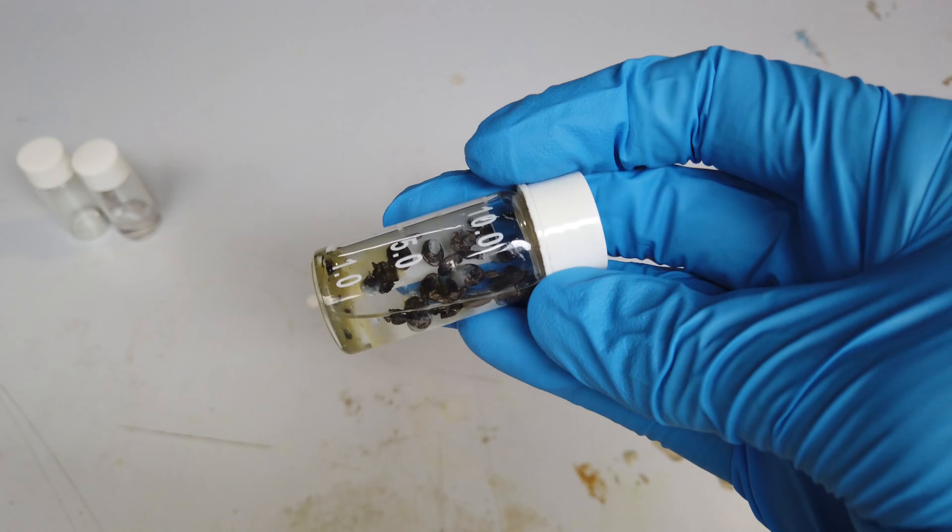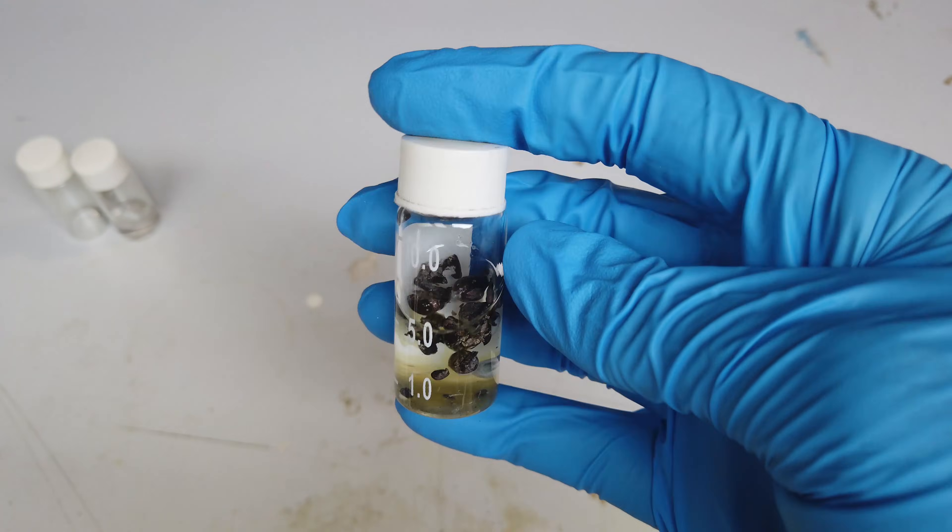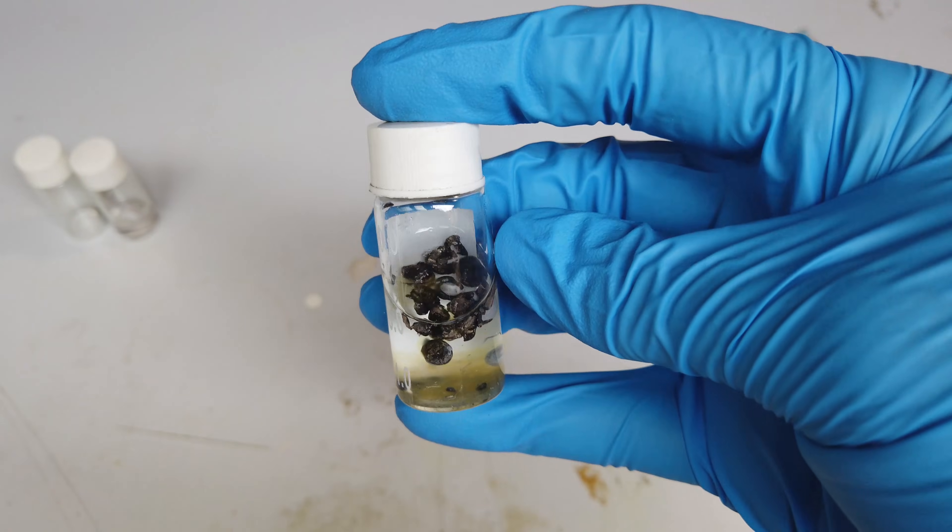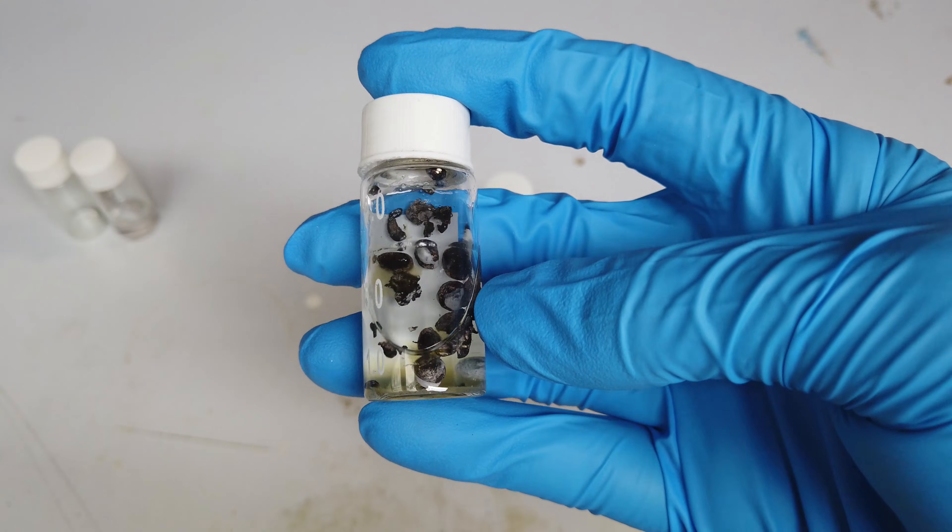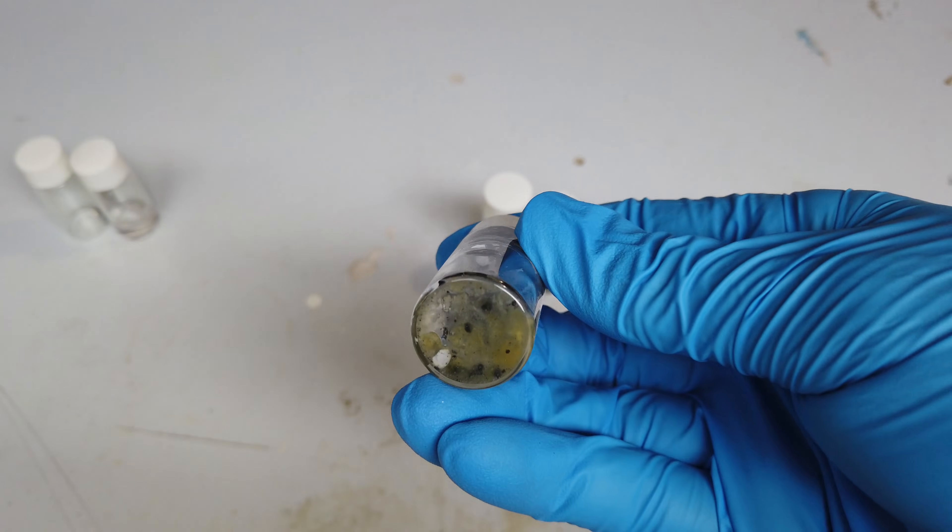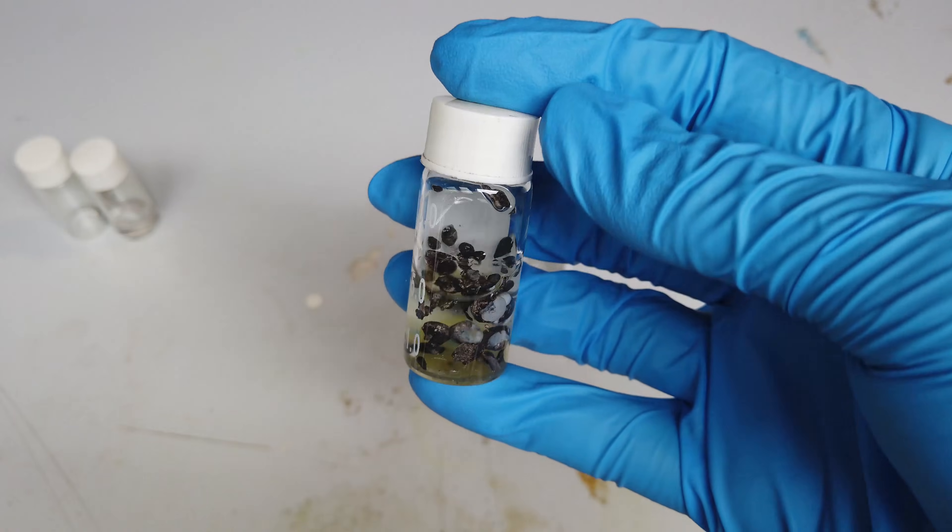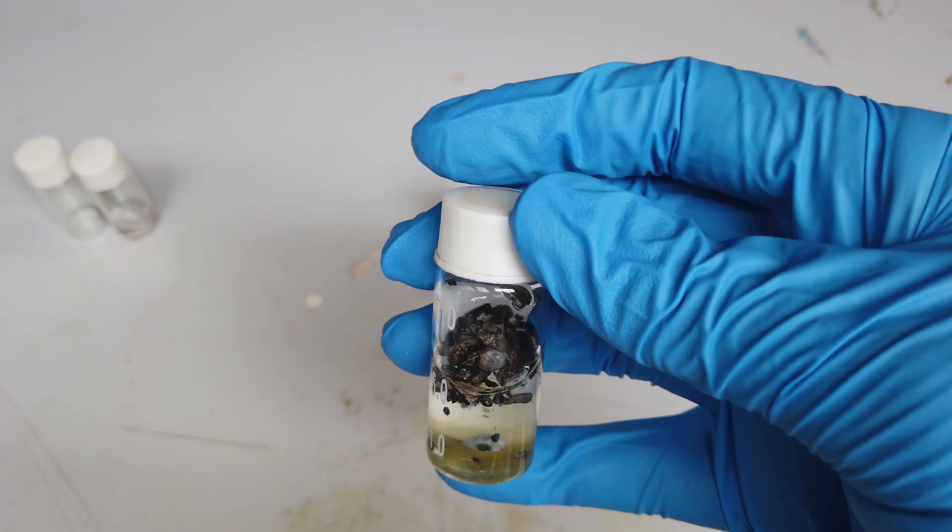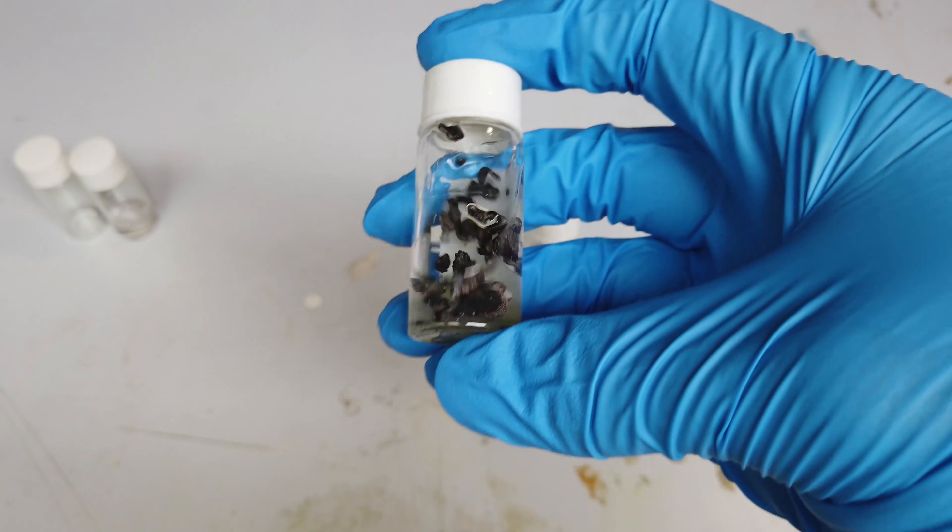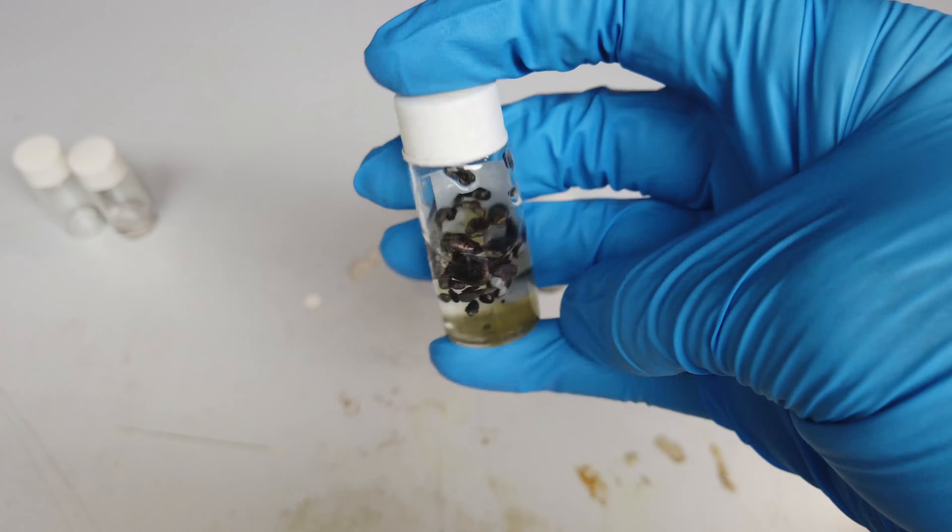Next, we made some lithium by electrolyzing Molten Lithium Chloride mixed with some Potassium Chloride. That makes lithium on the cathode. This really needs to be worked on because these beads of lithium are rather small. I'd like to coalesce them into one bead of lithium, and also the oil I'm storing them under has all this gunk. One of the goals for today is this lithium we made a while ago. I definitely want to melt it all together and give it some fresh oil.